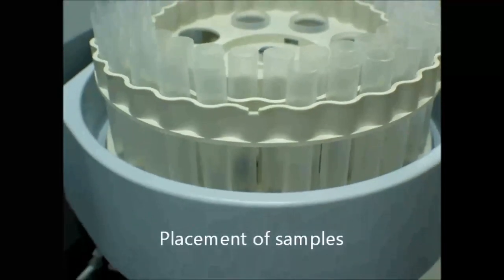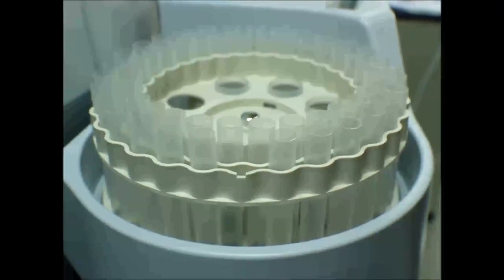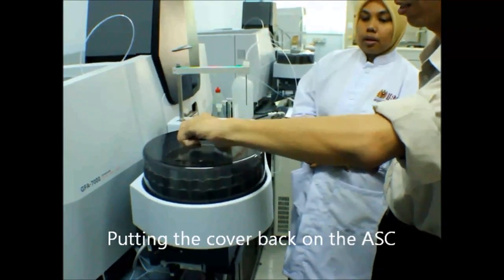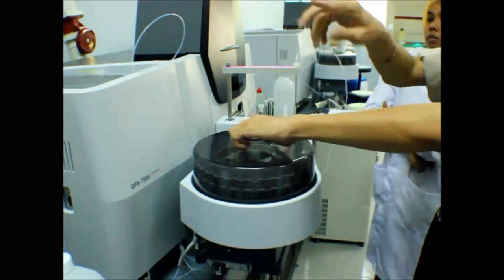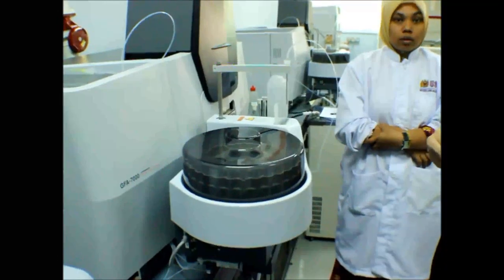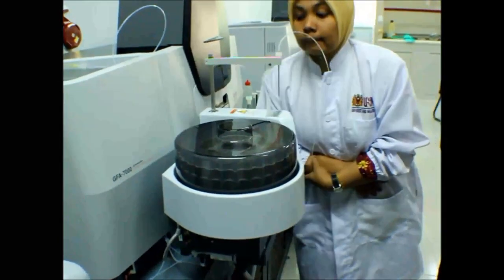This is number 1. R is for standard curve. So cover back is like that. Kita boleh letak ke mana-mana. We have one screw. You can put anywhere, but from the software you need to key in where is your file. Okay. If you start with 1 ppm, it's good, right? If you don't want, you can start with 10, 50, up to you.